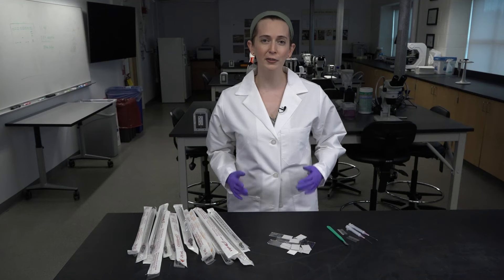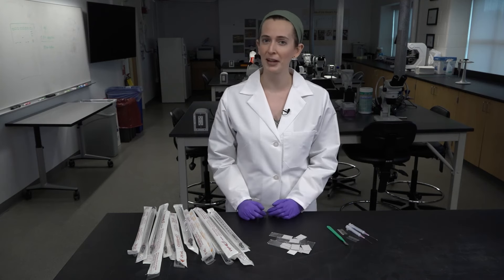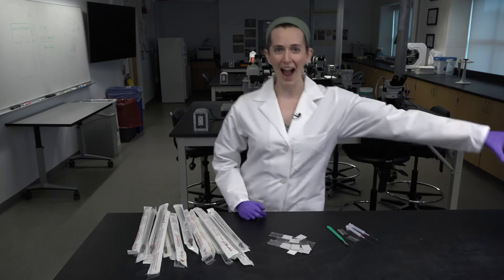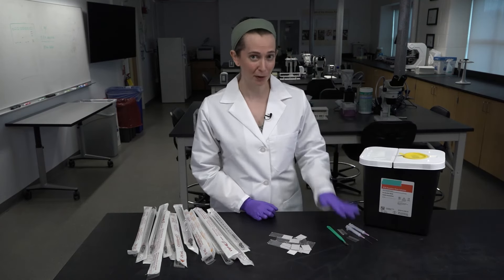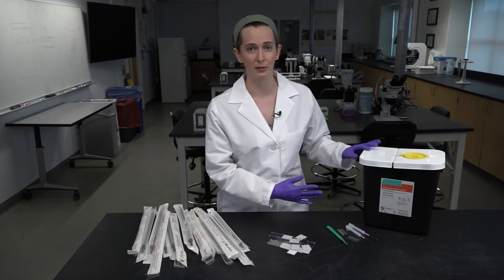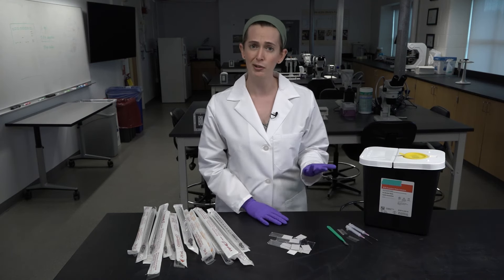We have a couple more waste types to discuss. Sometimes you'll use sharps for things that don't involve biological or chemical hazardous waste, and we have a special bin for that — it isn't red. It's so important to not put your sharps in the regular trash. They always need to go into a special container to prevent injury to your building's custodial staff, your lab mates, and yourself.